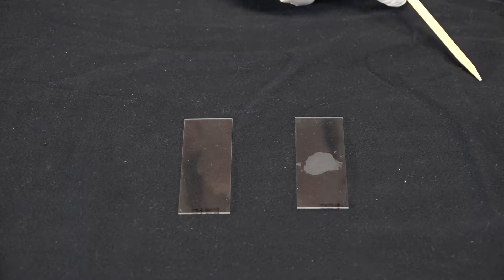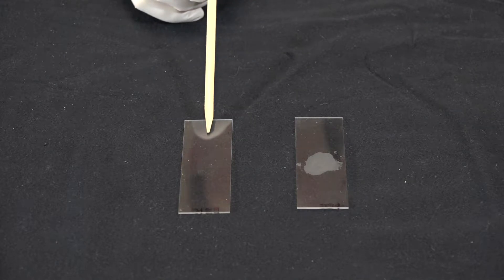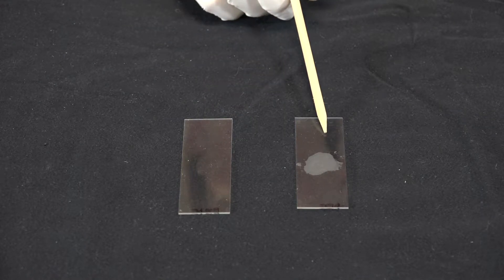I'm going to stain two heat fixed slides of bacteria. This one looks clear, this one looks opaque.